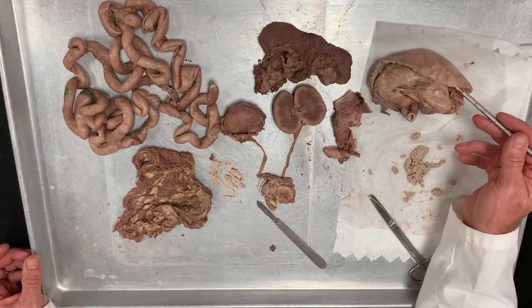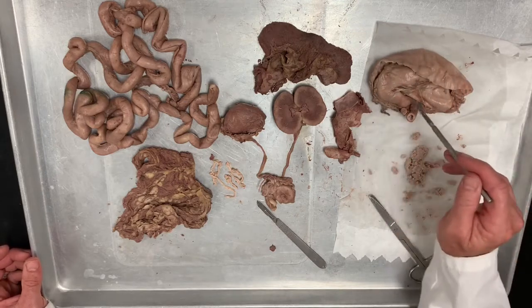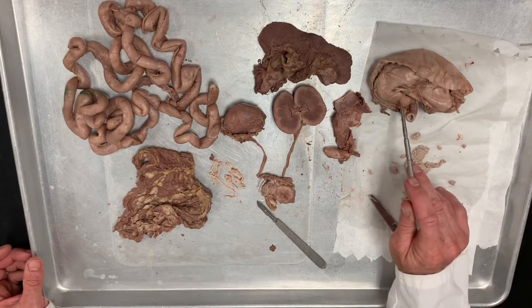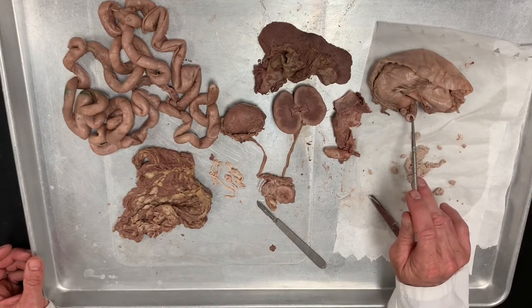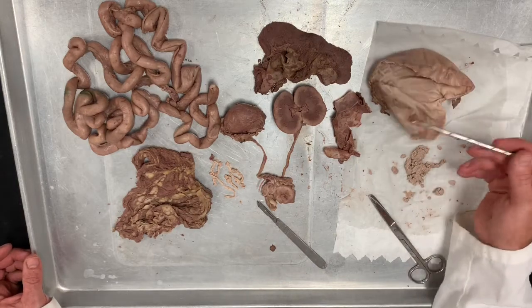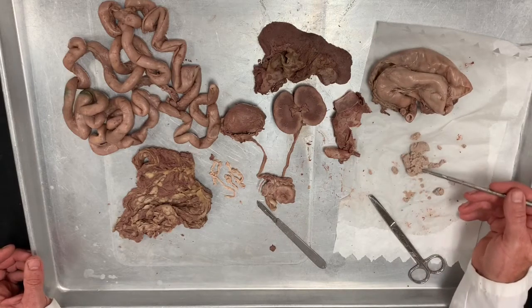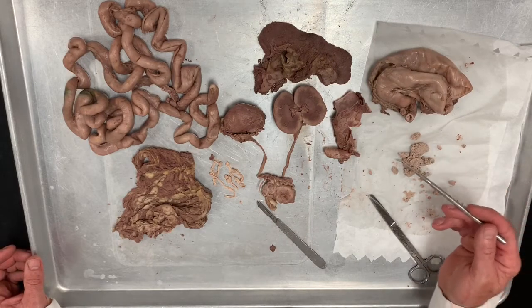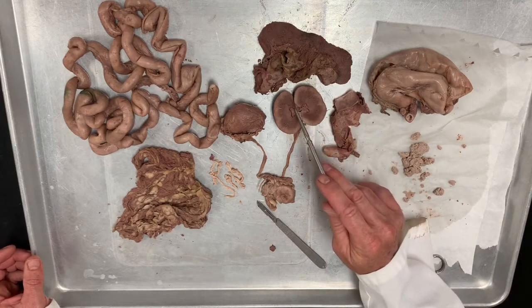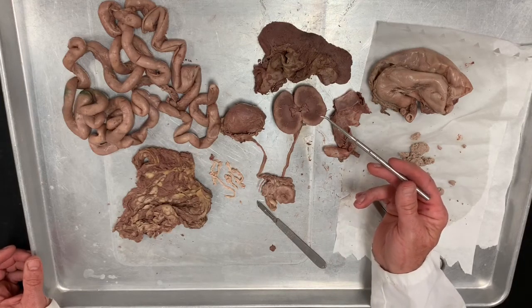Here we have the stomach and the rugae, the fundus, greater curvature, lesser curvature. There's the pyloric sphincter, and the beginning of the duodenum. And then up here we have the esophagus. Here's the stomach contents, the kibble. This is actually the renal capsule. This surrounded the kidney. Here I've done a butterfly cut on the kidney to kind of expose the major regions.